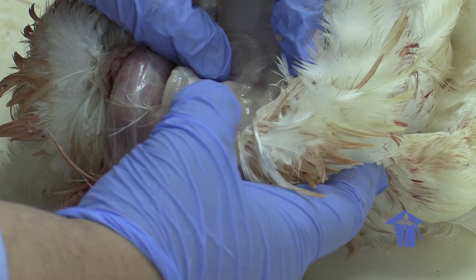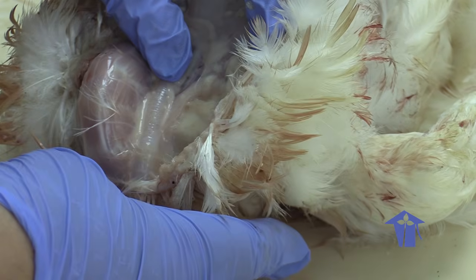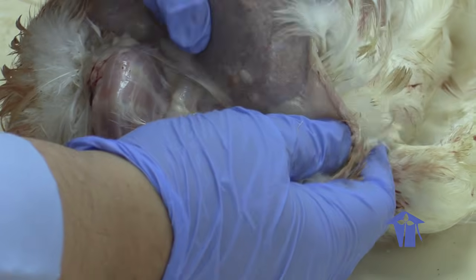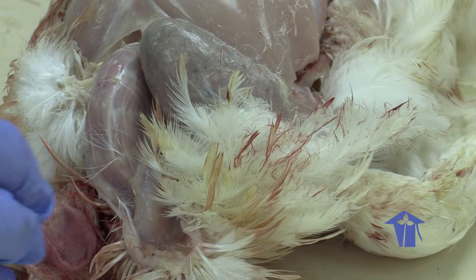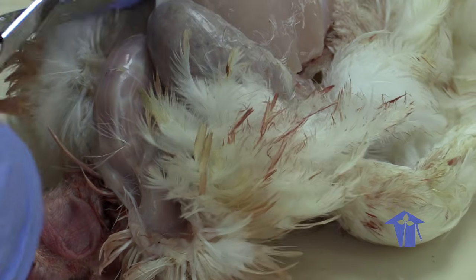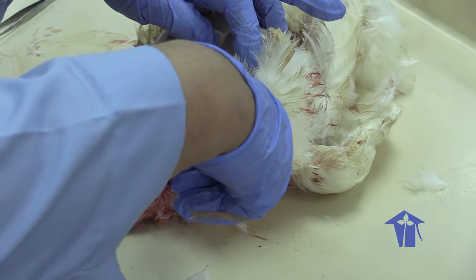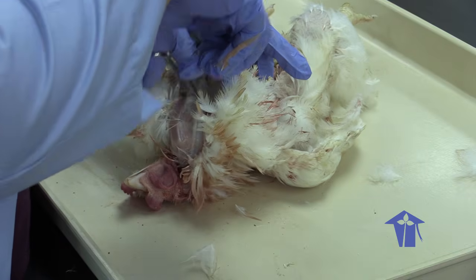And this soft squishy tube here is the esophagus. So food for the chicken, after the mouth, goes through the esophagus, and then it's going to enter this structure here called the crop. The crop is basically a store of the food material. So the food is going to be stored in that crop, and then eventually it'll be passed to the rest of the digestive system.